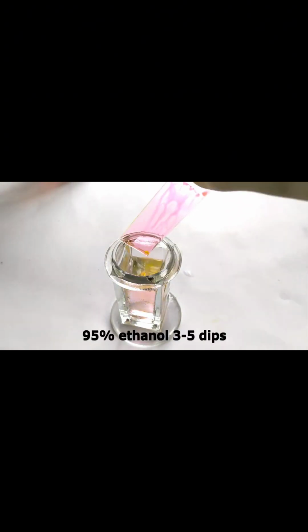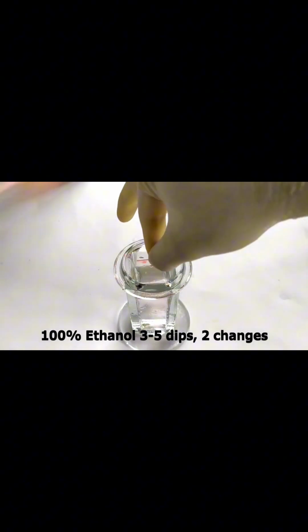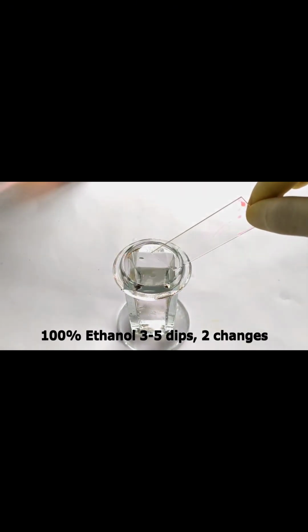Give the slide 3 to 5 dips in 95% ethanol, followed by another 3 to 5 dips in absolute ethanol with 2 changes, which is then followed by 3 to 5 dips in xylene with 2 changes.